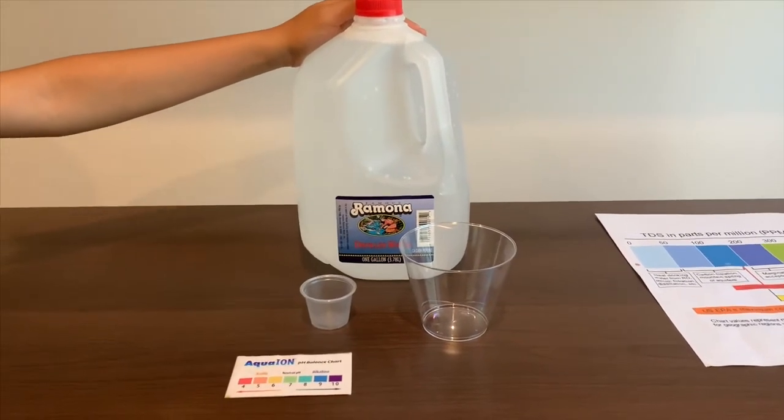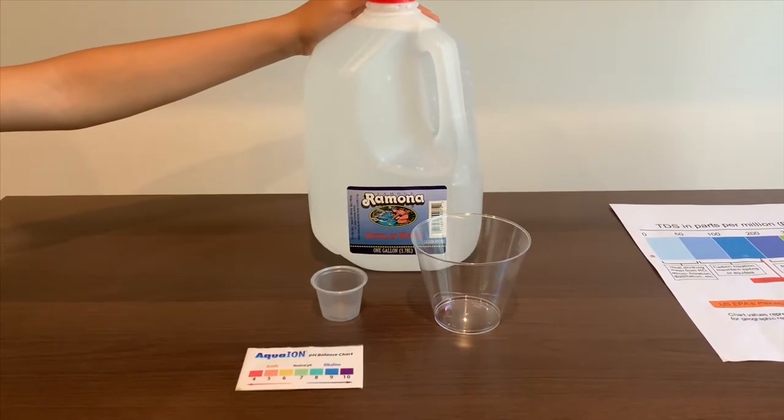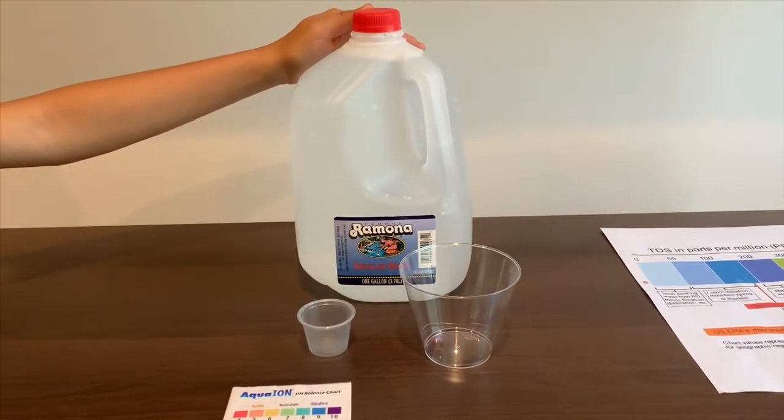This is famous Ramona distilled water. It's sourced from California. Let's test the pH and TDS of this.